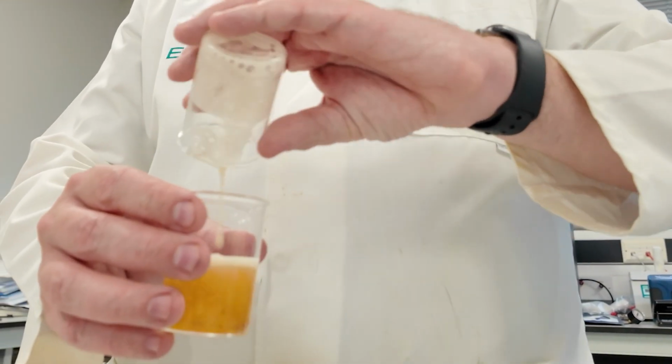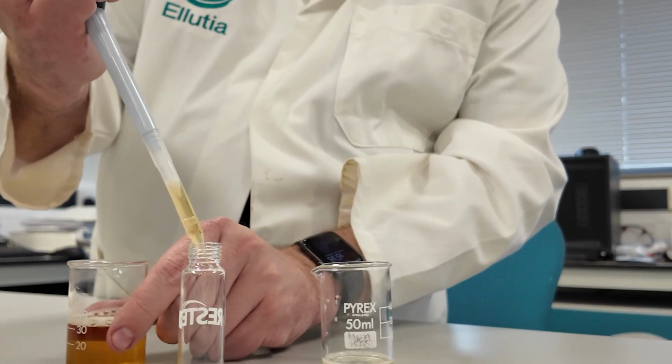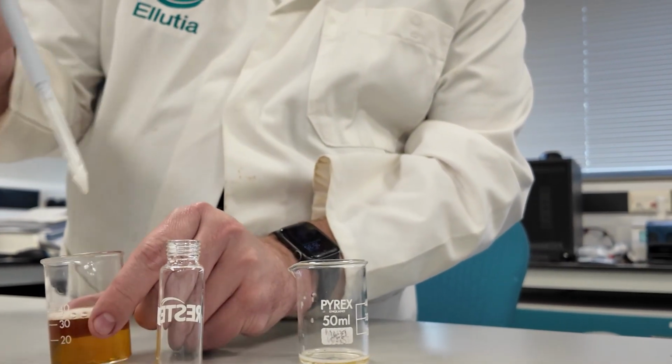Now, preparing a sample is very straightforward. You're going to start by degassing your beer by pouring it back and forth between 2 beakers until the foaming stops. This drives off the CO2, which otherwise would build up pressure when the sample is heated in the headspace vial. Once it's degassed, pipette 2 mL into a clean 20 mL headspace vial. Purge the vial briefly with nitrogen to remove any oxygen, then seal it tightly. This sample is now ready for analysis.